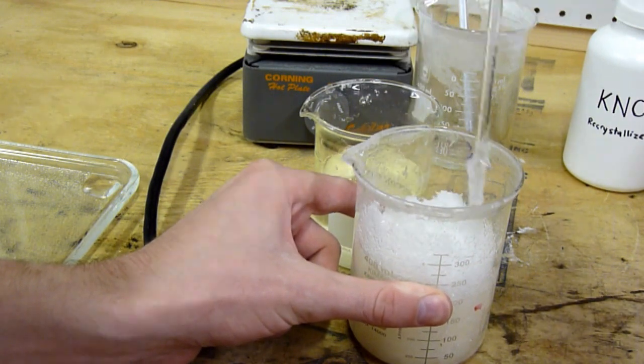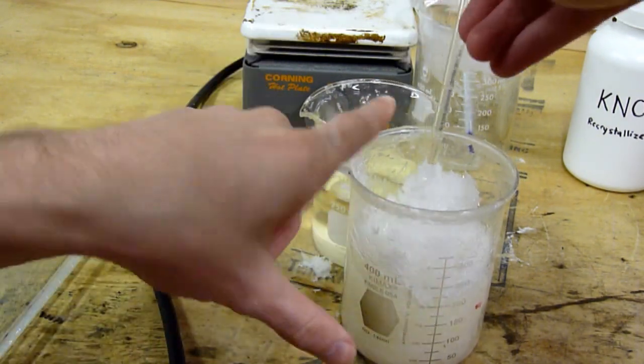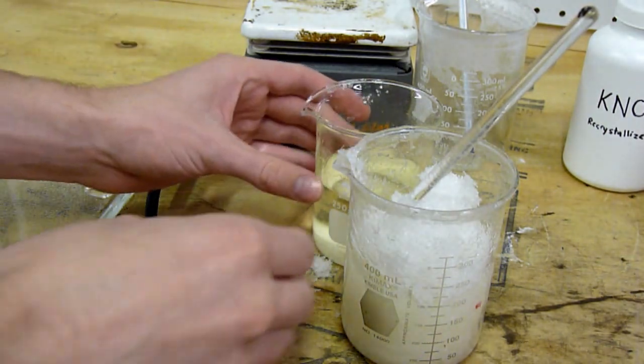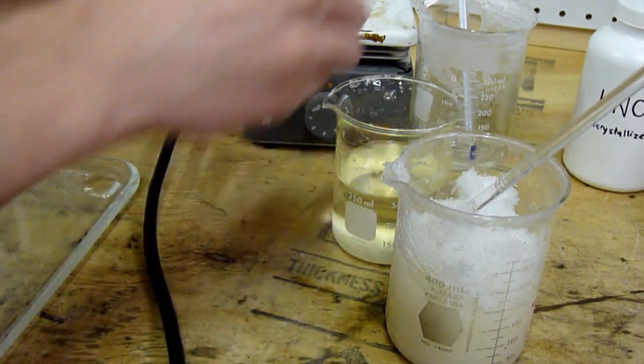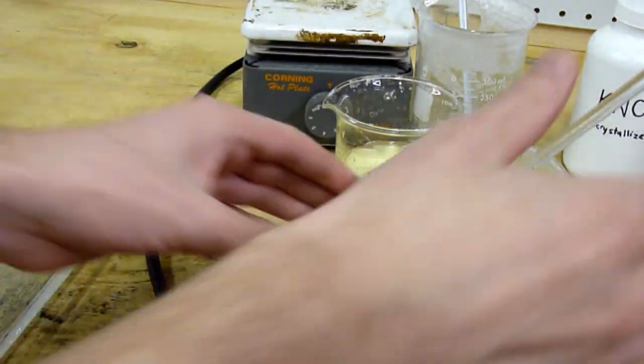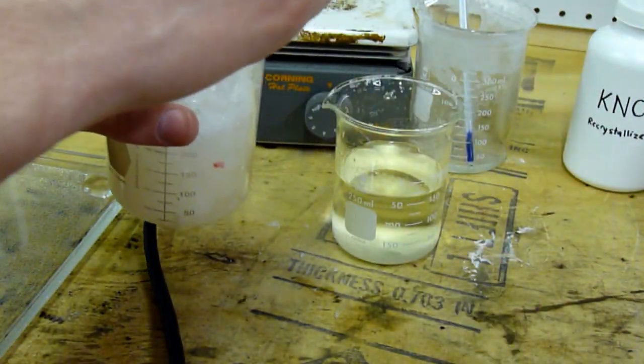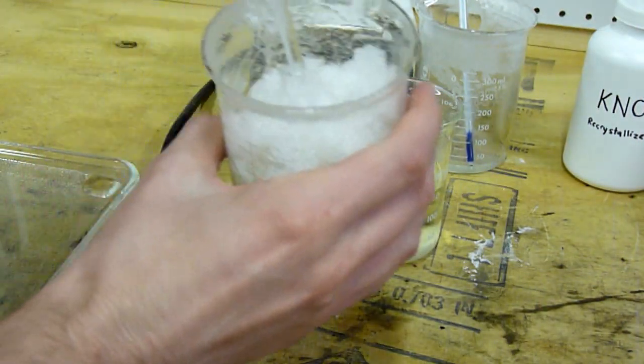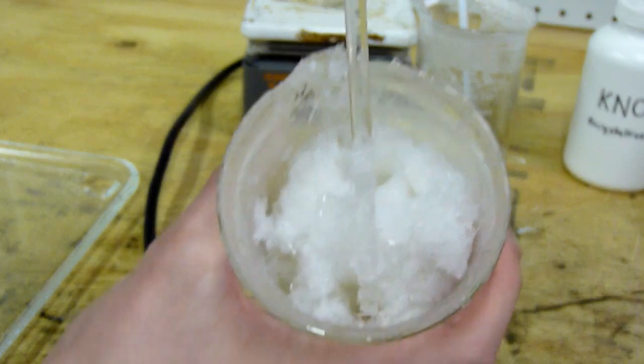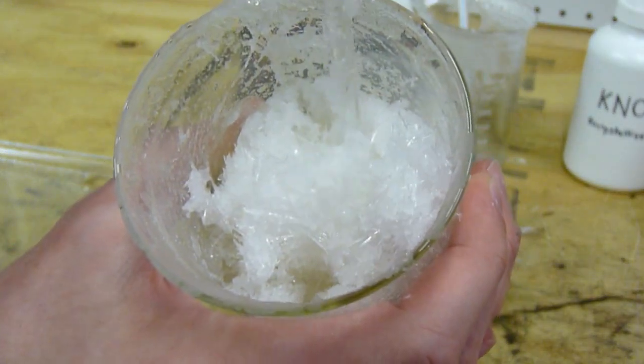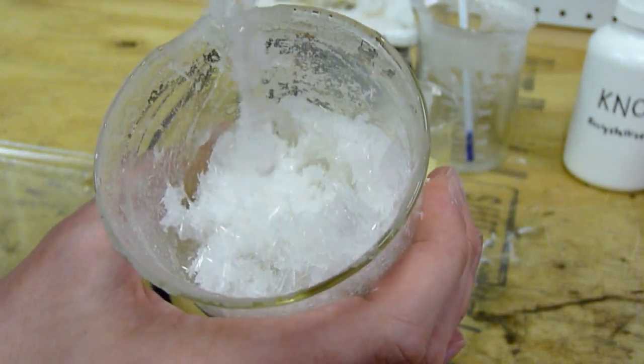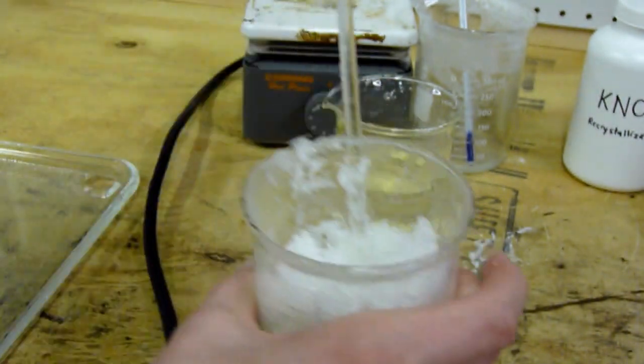Maybe I can break this up a bit. These crystals are very hard and just like really fine needles. I don't know if you can see that, but neat.